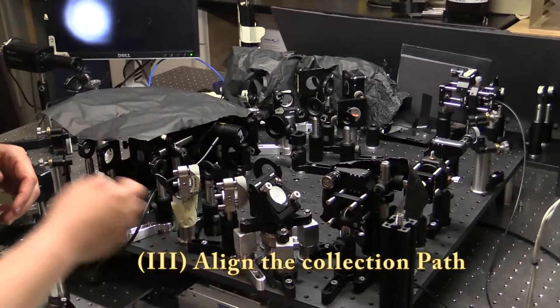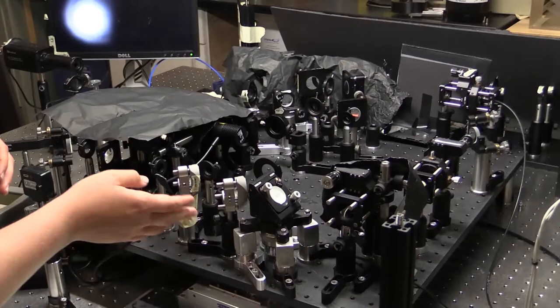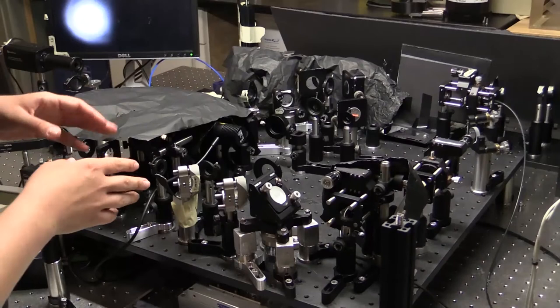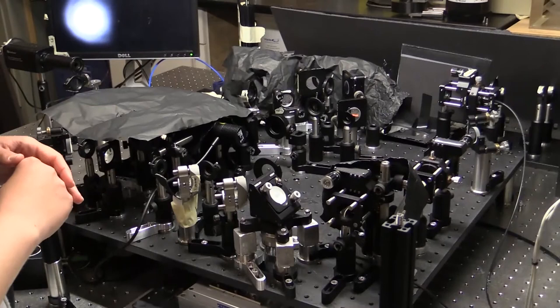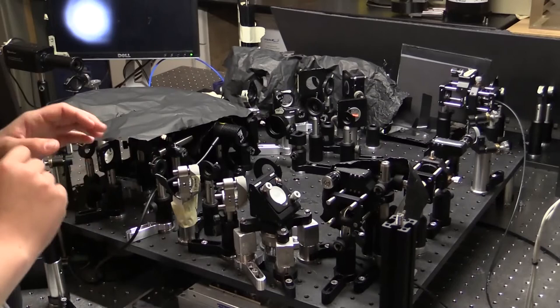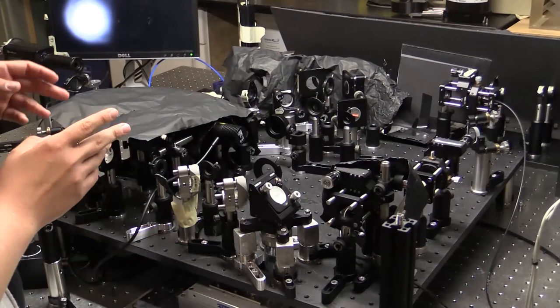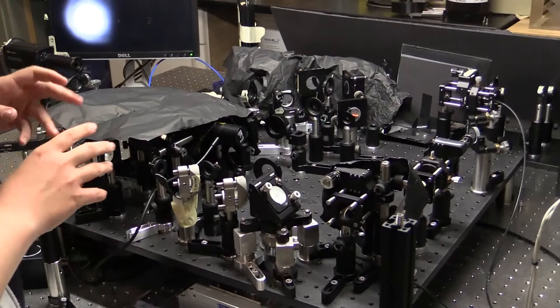Once you have your beam going to your sample and light coming out that you're collecting, we then have to send our collected light along our collection path. We again use the different alignment procedures we talked about earlier, either with one mirror or with two alignment mirrors. For space reasons I only have one mirror in this case, which makes alignment much more difficult than if I had two. I've already adjusted both the position along the plane perpendicular and twisted it to get my beam going roughly along this line of holes. Then once again I set up two irises and make sure that the beam is going directly to the center of both irises.